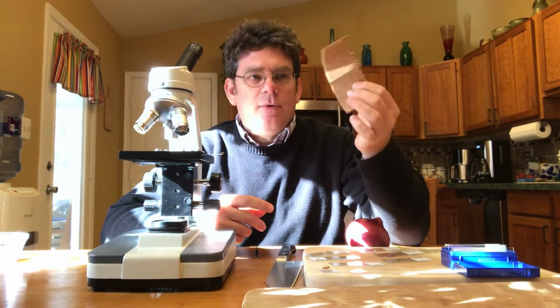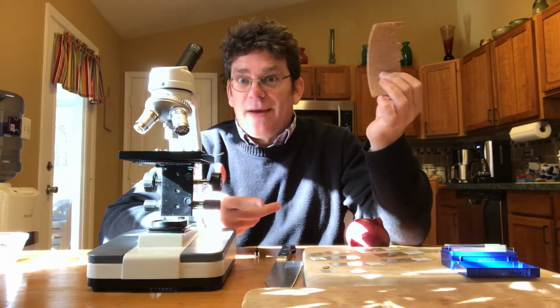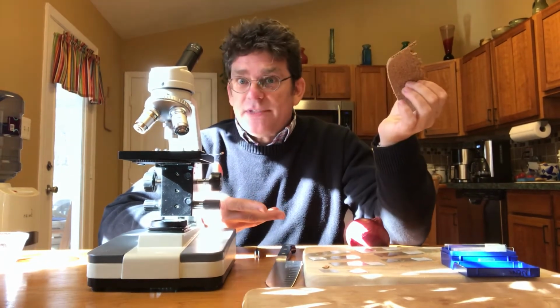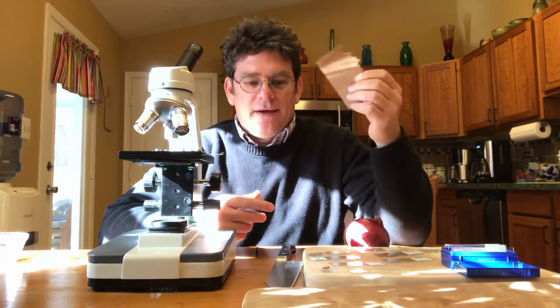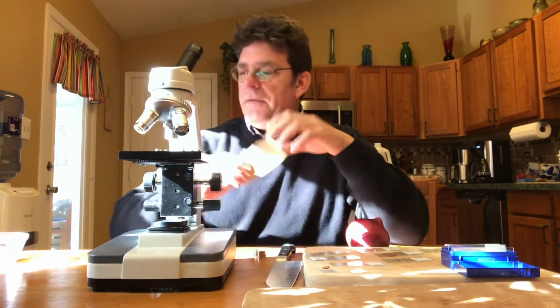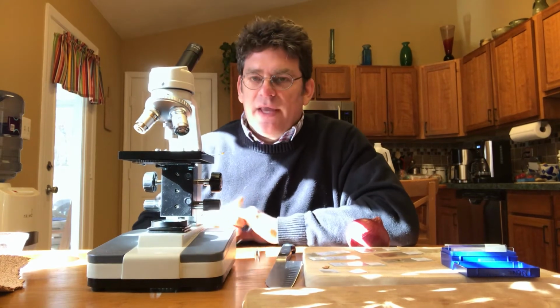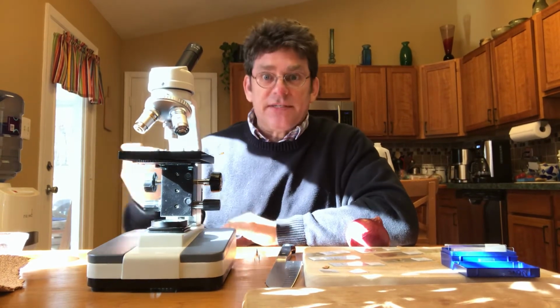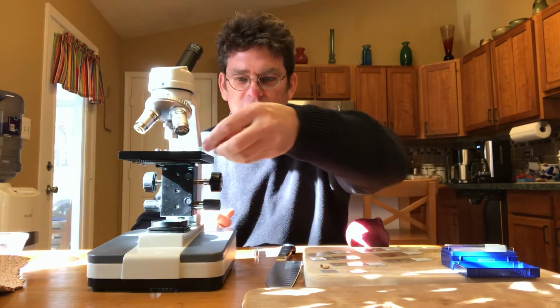So the reason I always like to start with looking at cork is it's the earliest thing a person looked at. Robert Hooke, who came up with the name cells, looked at a piece of cork just like this. And it certainly wasn't on a slide or something that he purchased from a company. It was just a piece of cork. So I always like for students to be able to see that, because that's how cells got their name, from this scientist Robert Hooke back in the 1600s. So that's the first thing I'll try to photograph if I can do it.